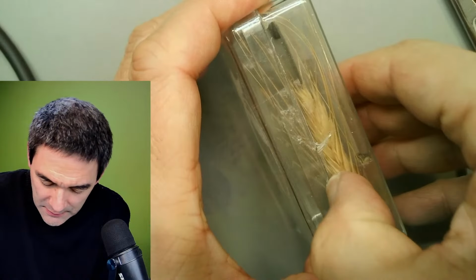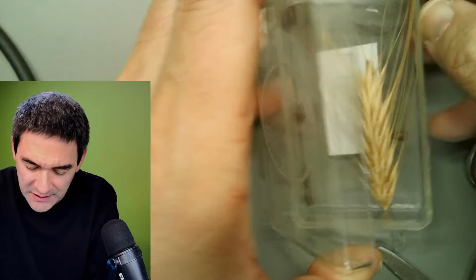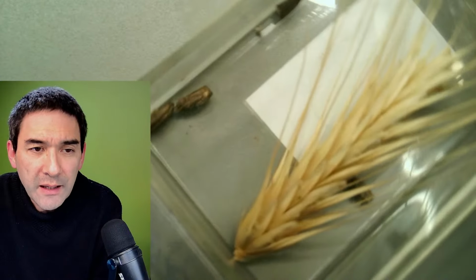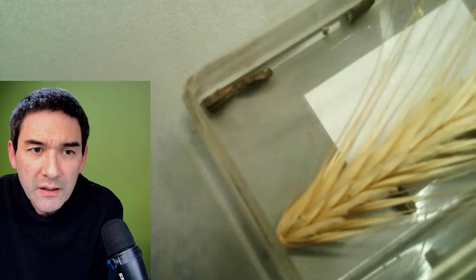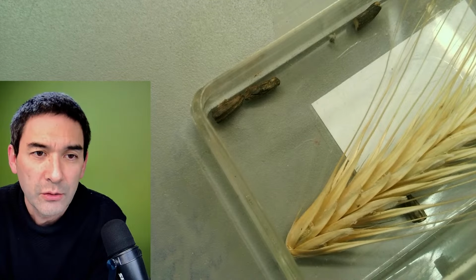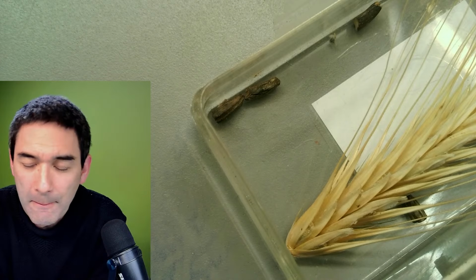And this is really interesting because it is a fungus. You know, it's a wheat grain, obviously. And those black kernels that you see here are not grains, but that's actually the fungus itself that's growing in the wheat. And this produces a very powerful poison called ergot, which causes severe hallucinations.